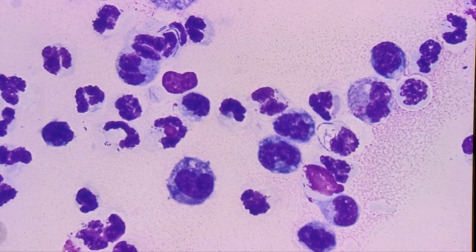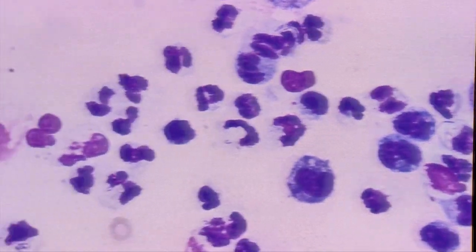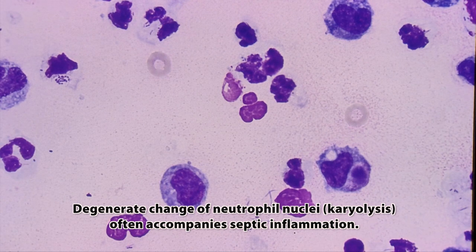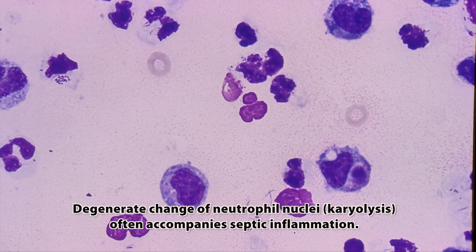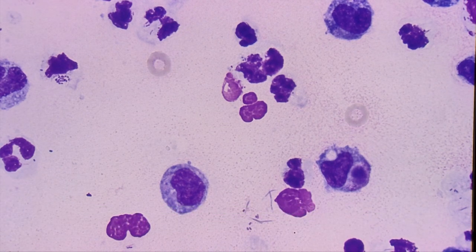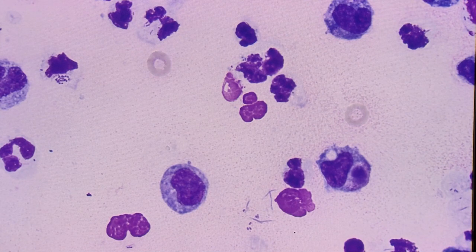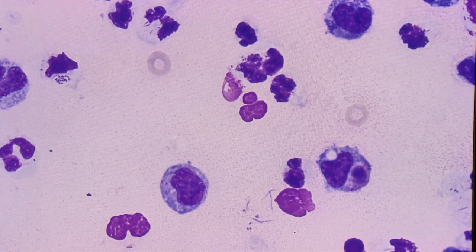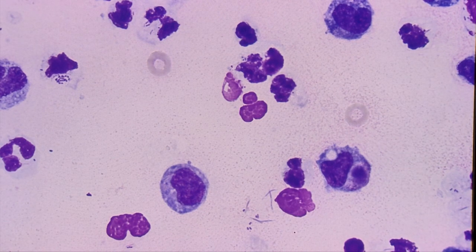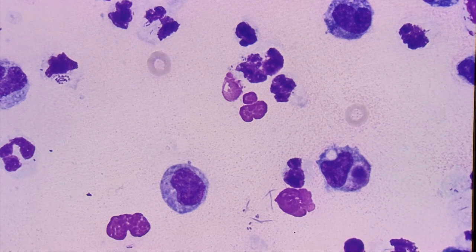So we have a nice bacterial population, we have neutrophils as the predominant cell type, and macrophages in much lesser numbers. Our interpretation of a case like this would be septic neutrophilic inflammation. This dog had a condition known as pyothorax, where there is purulent material within the thoracic cavity caused by bacteria — oftentimes this might be caused by a penetrating wound to the chest. That is the basic approach to examining a cytology slide. In other cases we may have a neoplastic cell population where we would have to decide if those cells have features of malignancy or whether they look like a benign population.